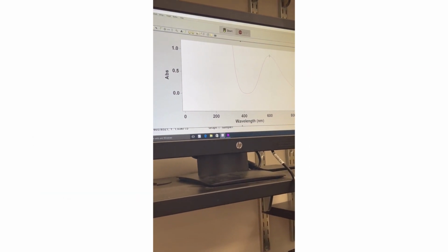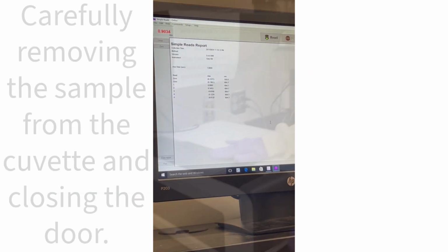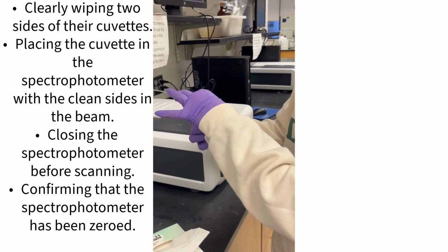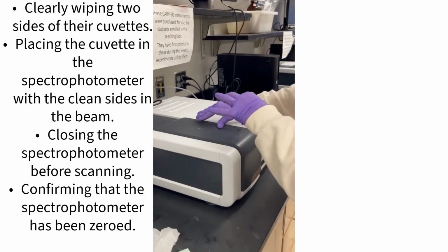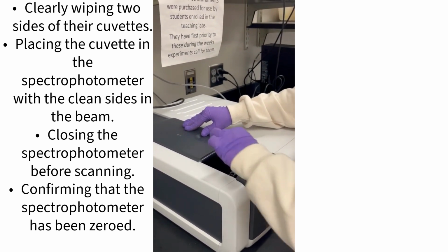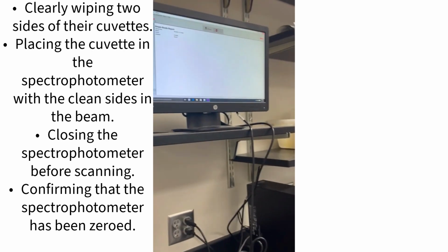Lambda max is the wavelength at which a substance has its strongest photon absorption. Lambda max is determined by plotting absorption versus wavelength and noting where the sample absorbs the most light, which is why it is necessary to collect absorbance data at different wavelengths.